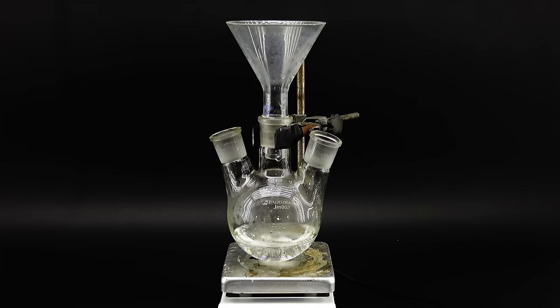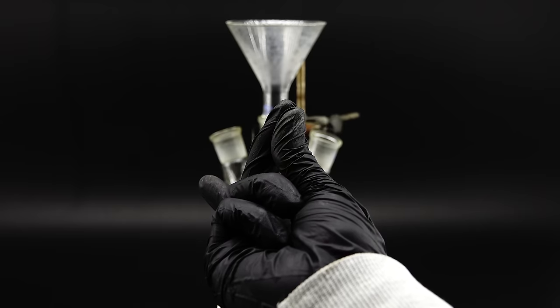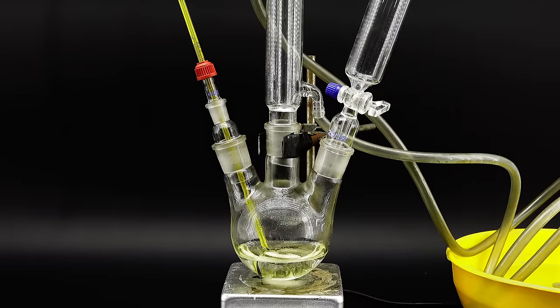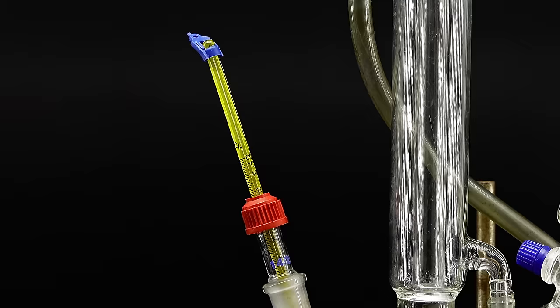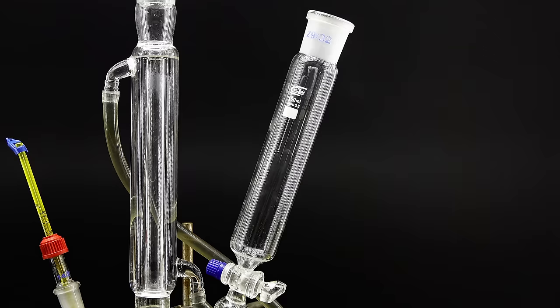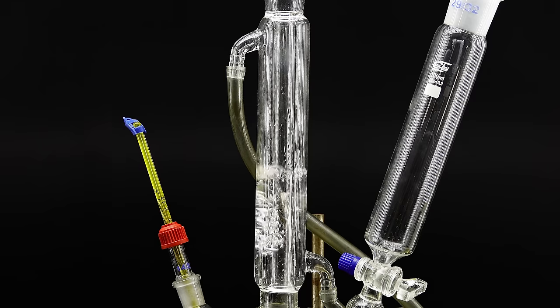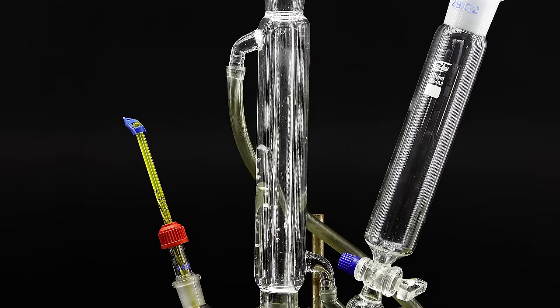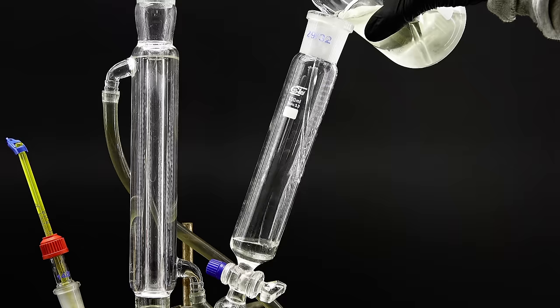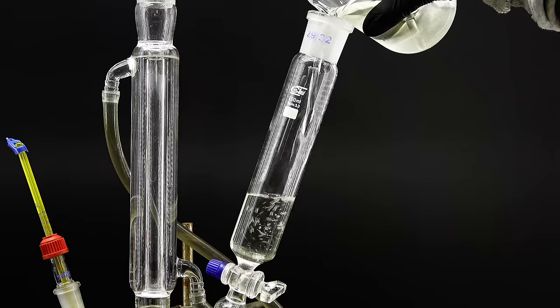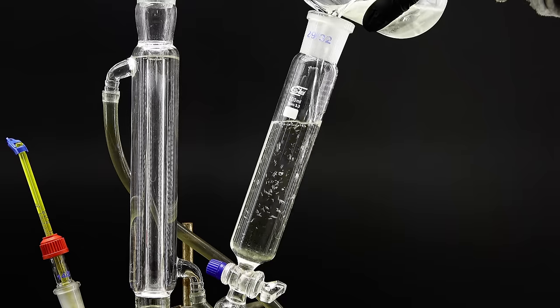Before pouring it into my flask however I first mounted all this fancy equipment onto its three necks, which consists of a thermometer, condenser and an addition funnel. The thermometer is quite self-explanatory and the condenser serves to keep any vapors from escaping out of the flask. The addition funnel also allows me to add my nitrite solution really slowly.